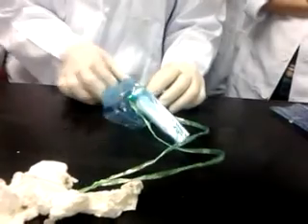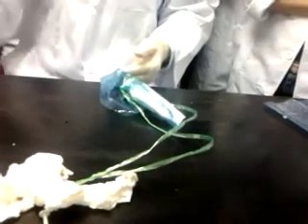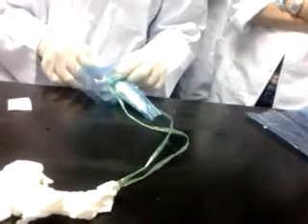Don't choke the animals, make sure they can breathe. You can see the breathing, so they can breathe the air and are not choking. We have to do it fast so that the animals are not so stressed. Okay, look for the lateral vein. When you do the lateral vein, you need to apply a tourniquet, use an alcohol swab, and tap it.